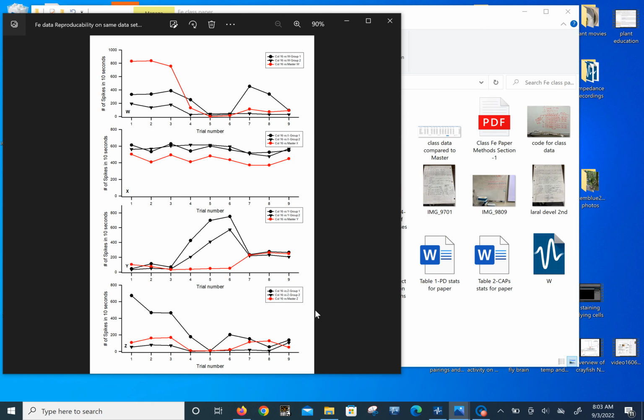So the take home of this is to show that these automated analyses can really mess you up. And so you put this data up online like journals ask you to, and then somebody else goes in and analyzes it. And it almost doesn't make sense unless you have a movie or really detailed instructions that the noise changes on every setup or every run or trial, and that you really have to watch out that or count the spikes by hand from 2 times the noise level to make sure you get the right accurate numbers.